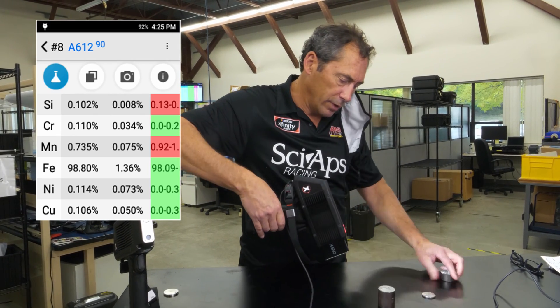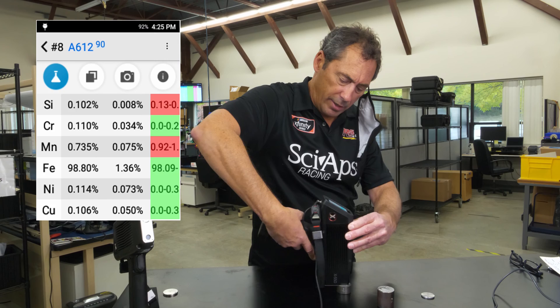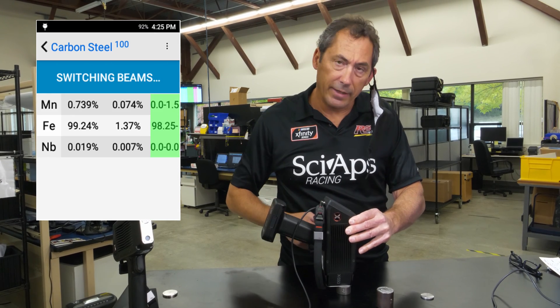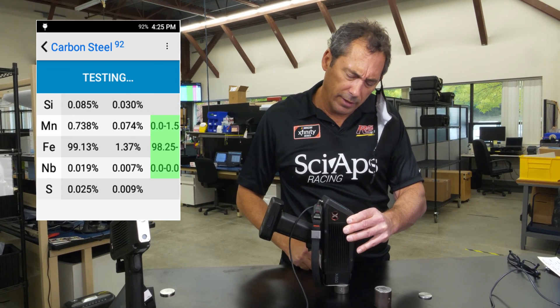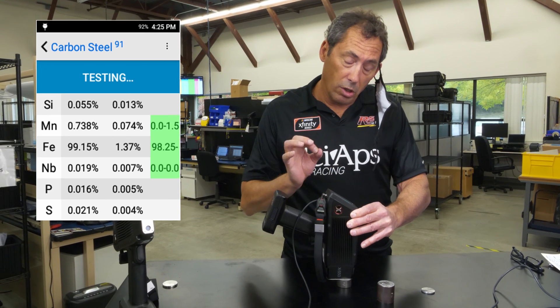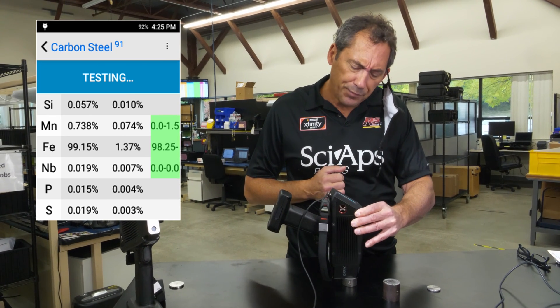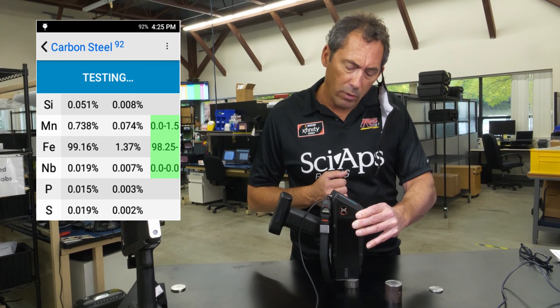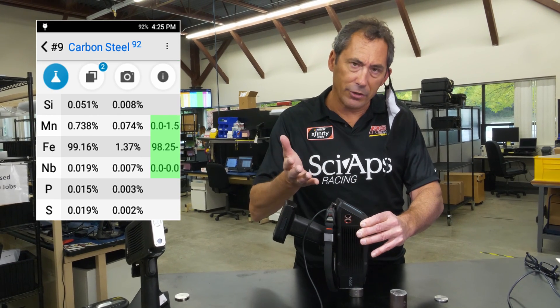Now let's flip over to a different sample. Hit that trigger. After one second, it's a steel. Now you're measuring your silicon, and you'll see this is a low one — down around 0.06. Silicon well below the 0.1% threshold. Five or six seconds and you're done.